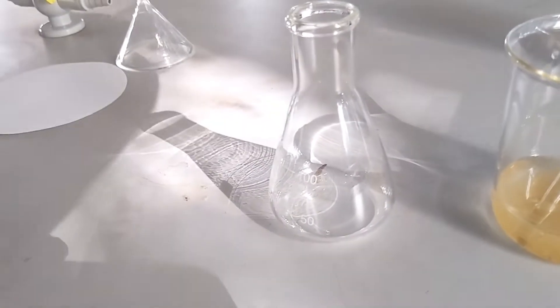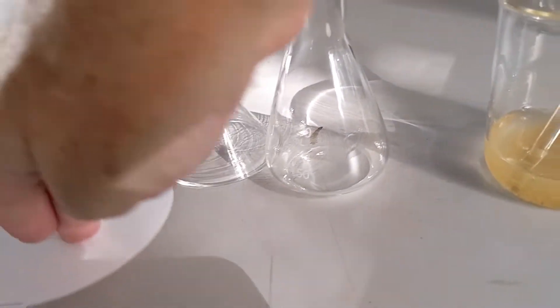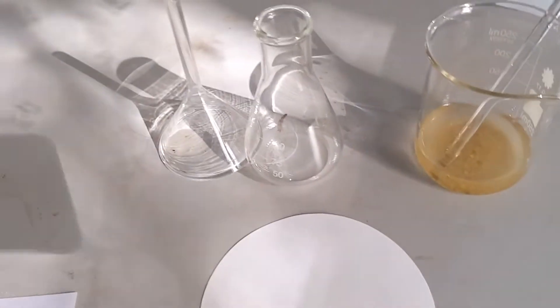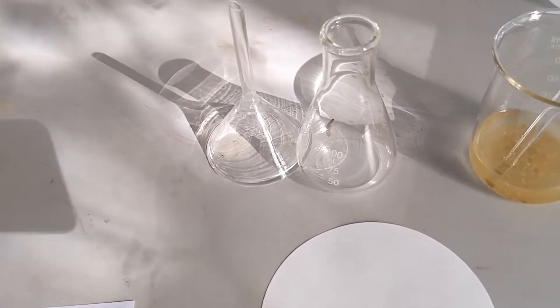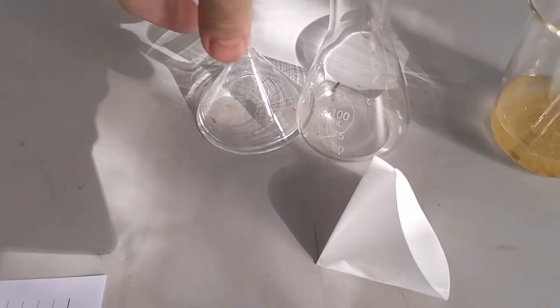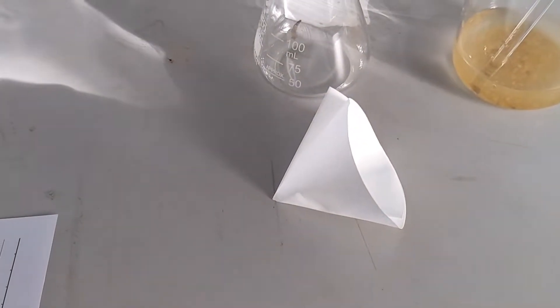We take a conical flask, a funnel and a filter paper. The filter paper we fold into a cone. What's this technique called?